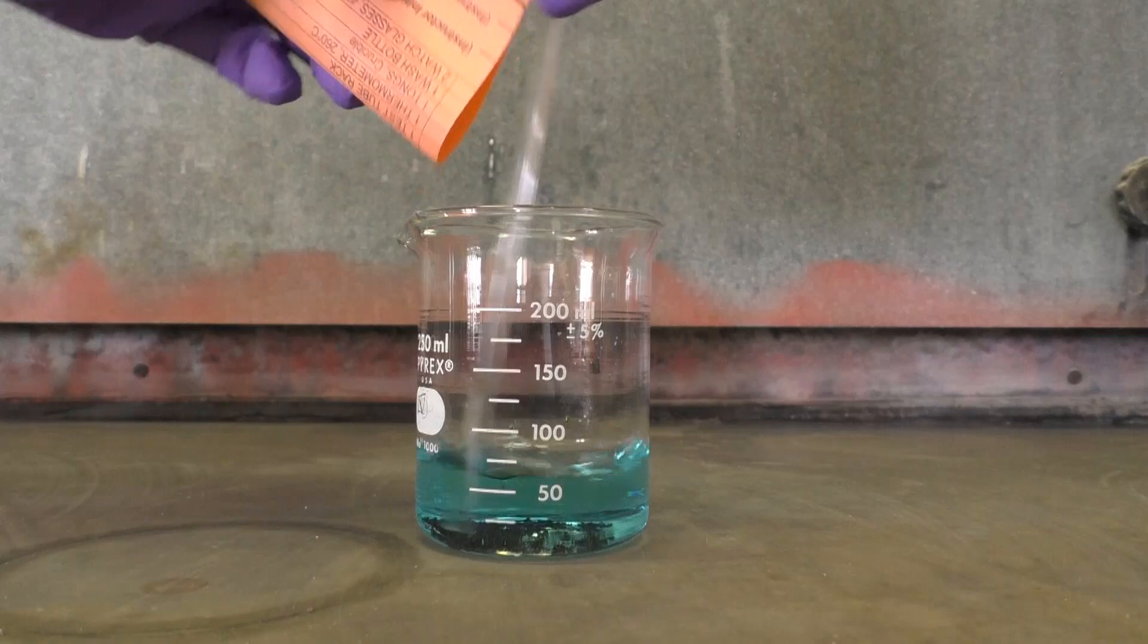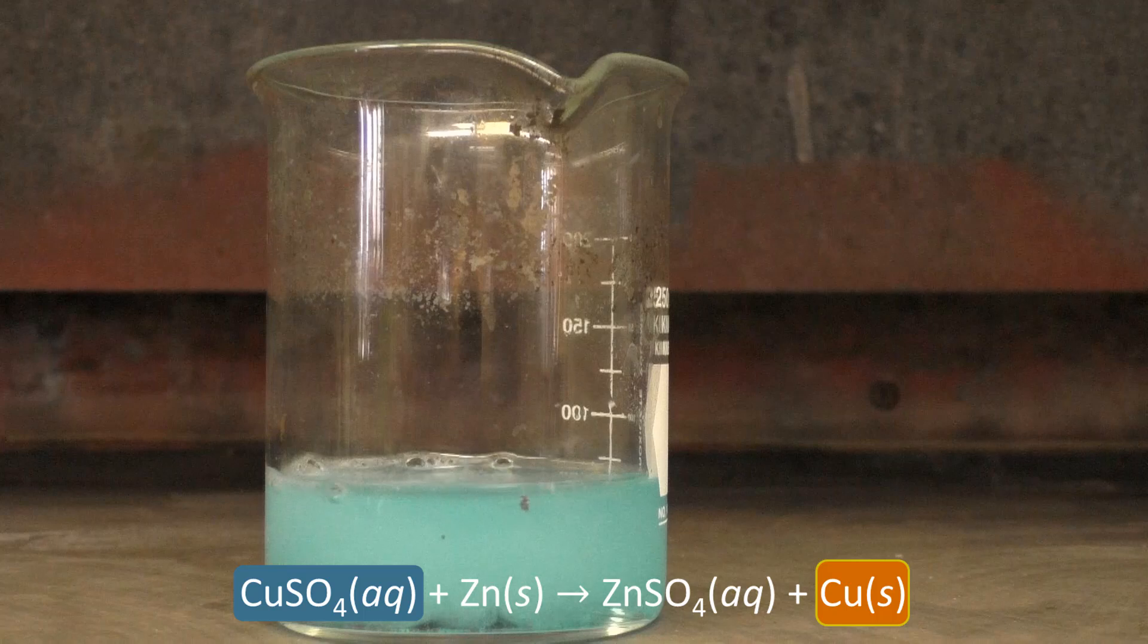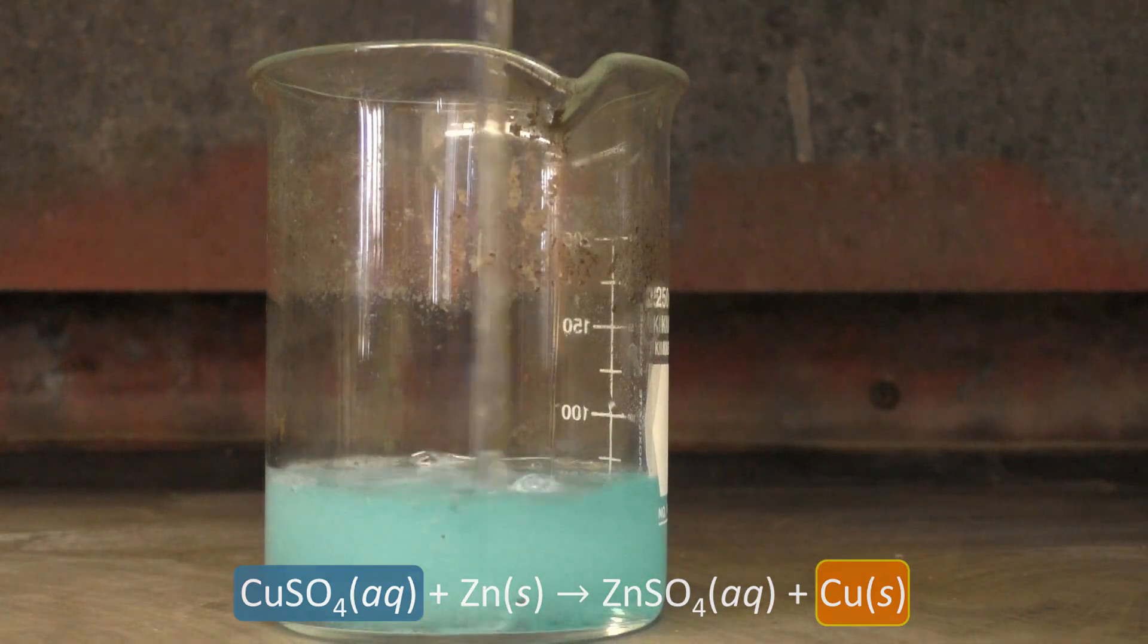You should see a copper solid forming, and you can tell the reaction is complete when your blue solution turns colorless and stops bubbling.